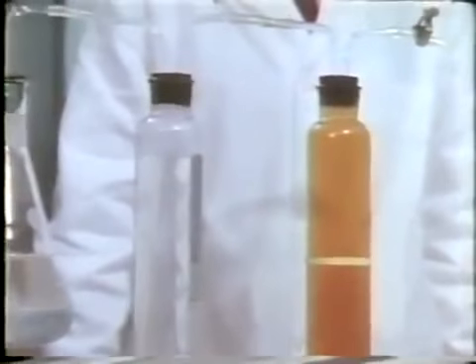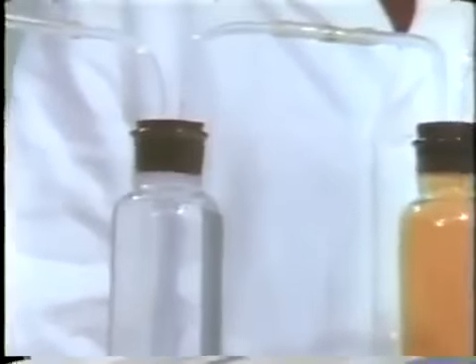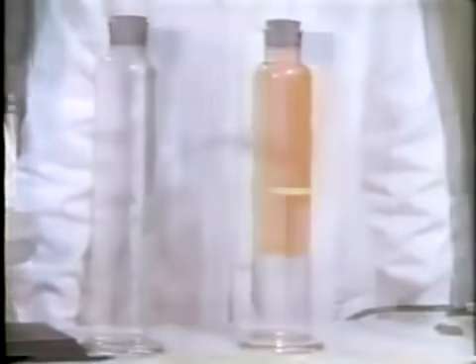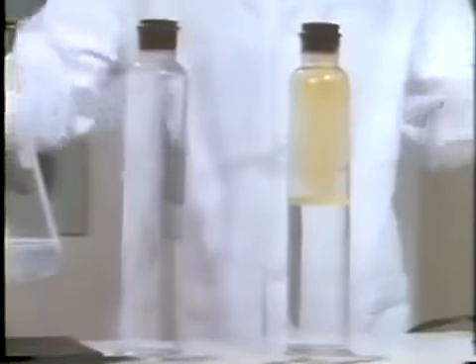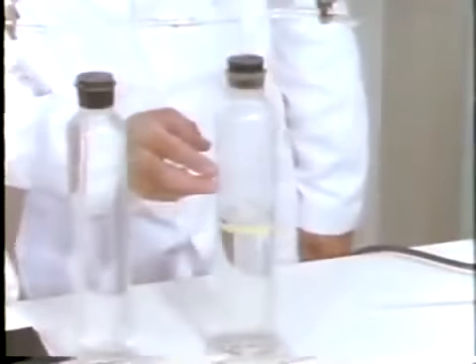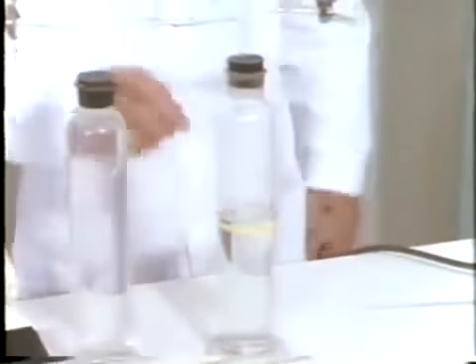The water continues to enter the oxygen cylinder as long as oxygen remains. Then, when the oxygen is expended, water begins to transfer into the nitric oxide chamber. We see the color of nitrogen dioxide is decreasing. Remember, nitrogen dioxide dissolves in water. As the nitrogen dioxide color disappears, the water transfer ceases. Now the color is gone, and we see that the water level is slightly above the halfway mark.